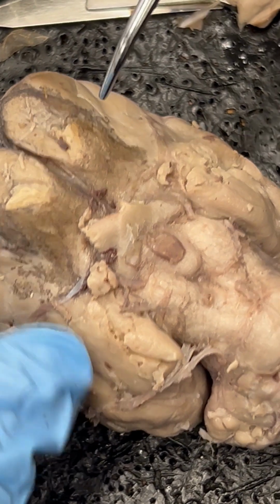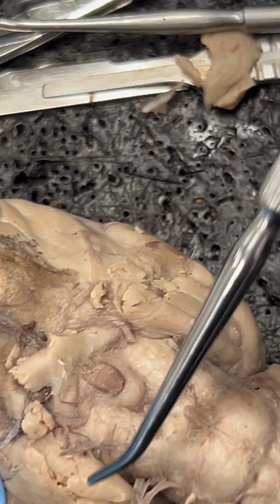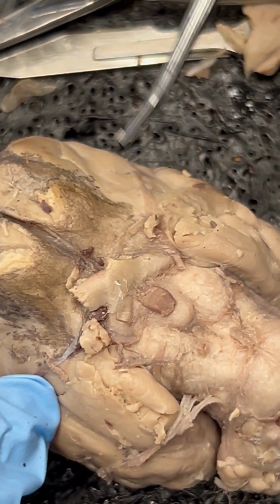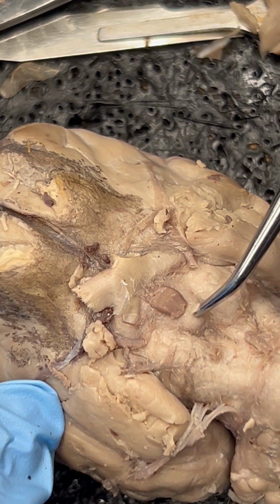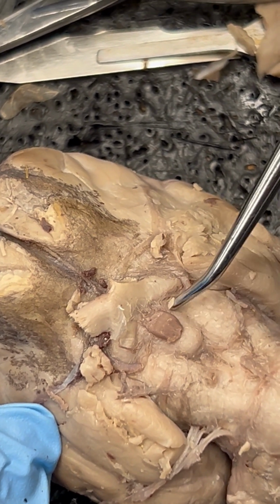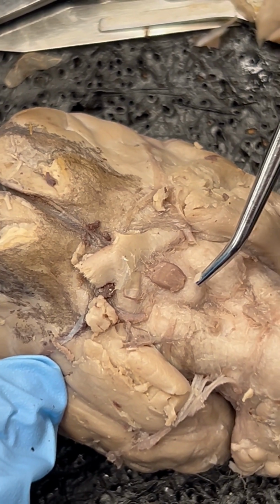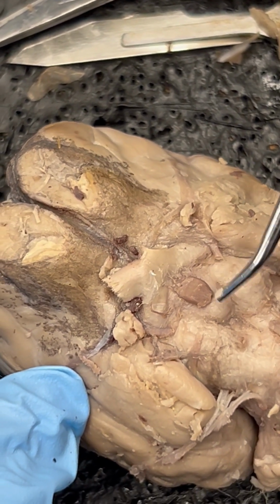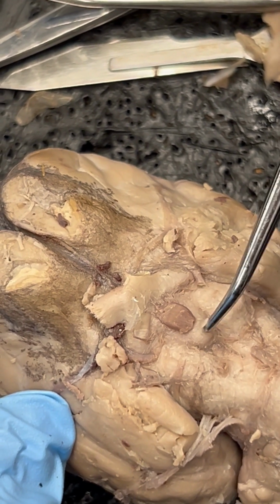Number 9 is the piriform lobe that we can see on either side. Piriform lobe. Number 10 is the mammillary body. Here is the mammillary body, and we see kind of going cranially, we have the tuber cinereum. Now, in the picture in your lab manual, it does make the mammillary body look more like 2 structures. There can be variation within specimens, but I do expect the majority of yours to look more like this, which is a medial swelling.